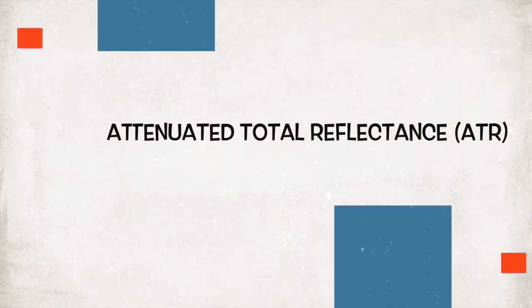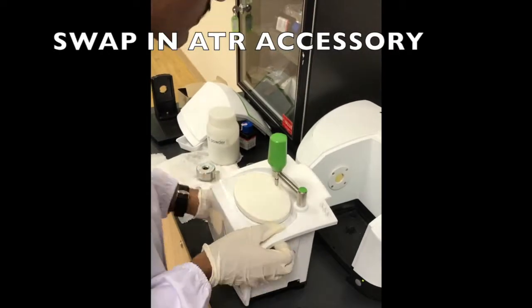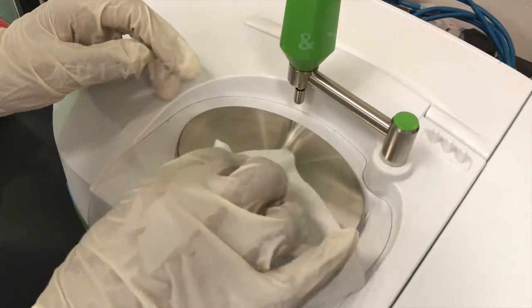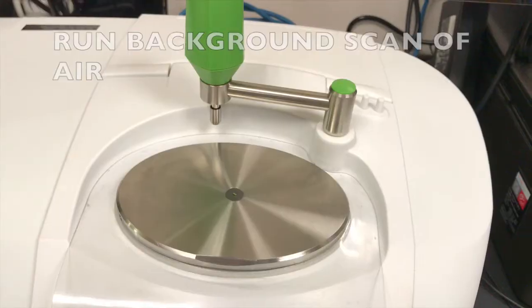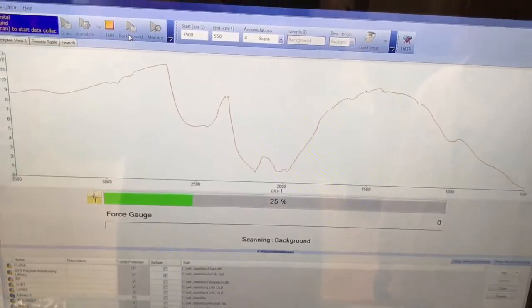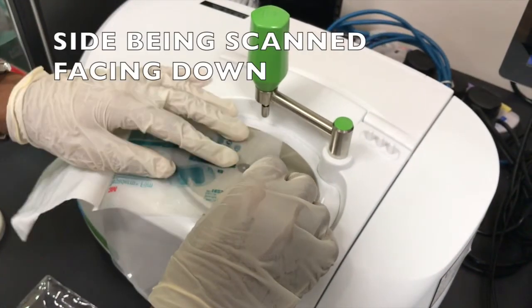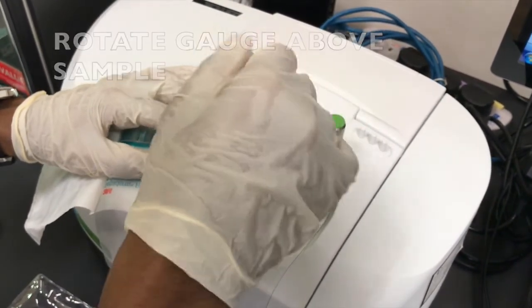With ATR, no sample preparation is required. To start off ATR analysis, firstly swap in the ATR accessory. Next, clean the crystal and the tip of the force gauge using Kim wipes. Run a background scan of air. Then, place the sample with the side that you want to scan facing down. Rotate the force gauge above the sample.